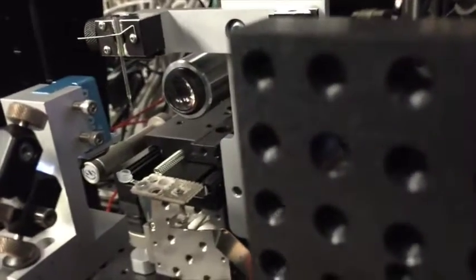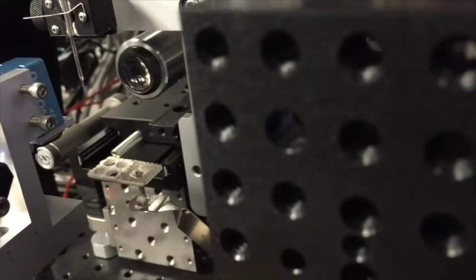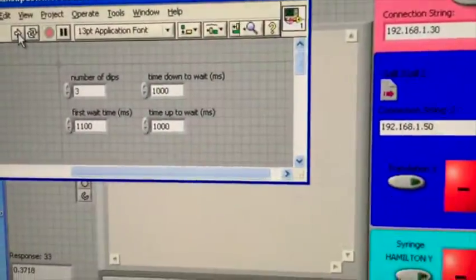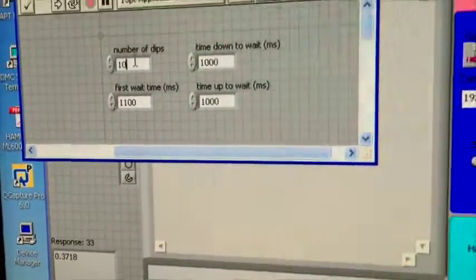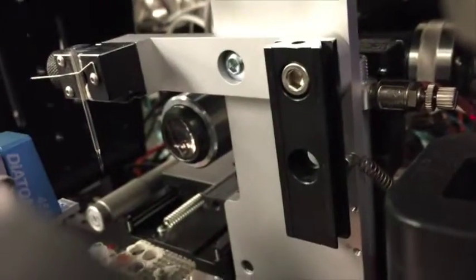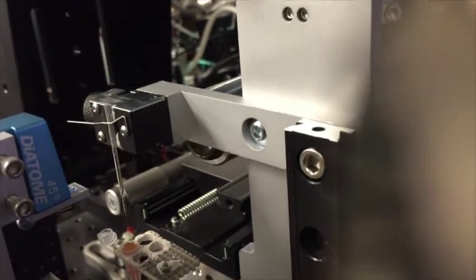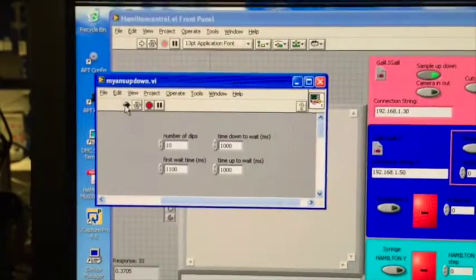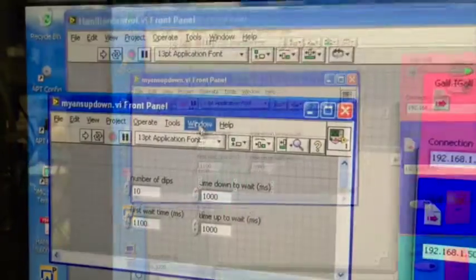Now I'm going to change out this polylysine, and in its place I'm going to put my gold. Now I'm going to change the gold to 10 dips. So we just found out that's what works for us. So I'm going to go in here and physically change this. And I'm going to hit that button again. And when I hit that button, my arm's going to go up and down again right there. It's going to go 10 times. So as this program gets to 10 dips, it's going to automatically turn off, which it just did.